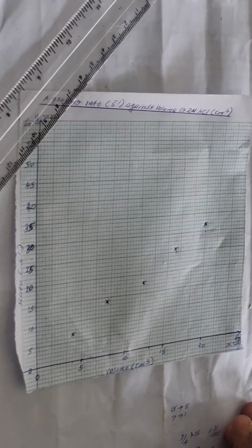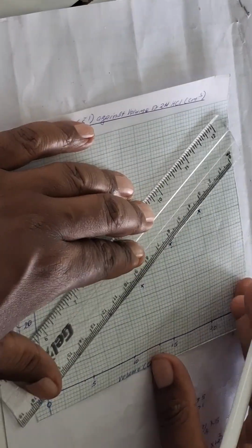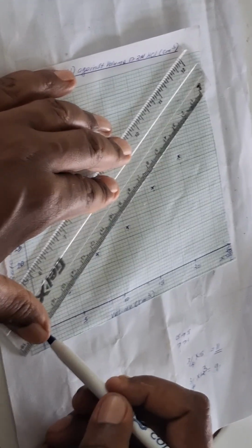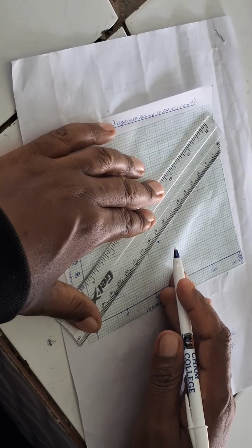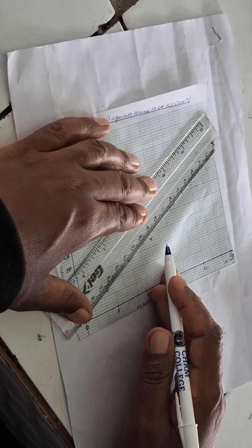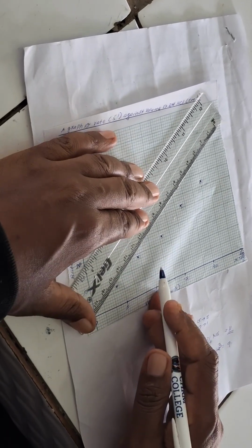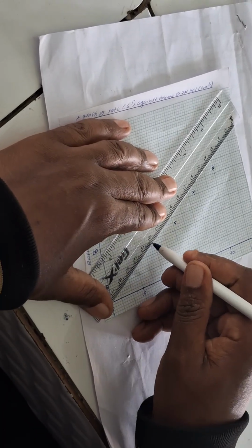That we have obtained. We are going to join these plots using a line of best fit, which should be going through the origin. That is going through 0. So we look for the line of best fit with at least 2 points. This one is not bad. We have these 2 points, and they are going through the origin. We can try these other ones. We see if we are having 2 which are going through the origin. Let us see these 2. They are not going through the origin. These 2 are not going through the origin. The only 2 which are going through the origin are this one and this one.